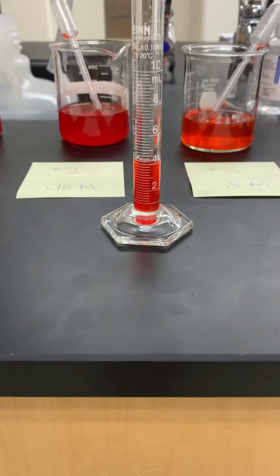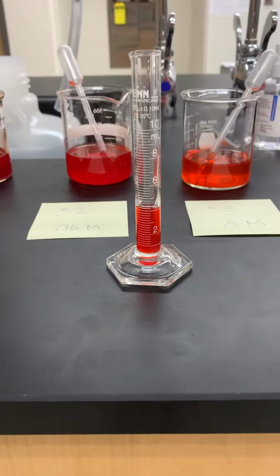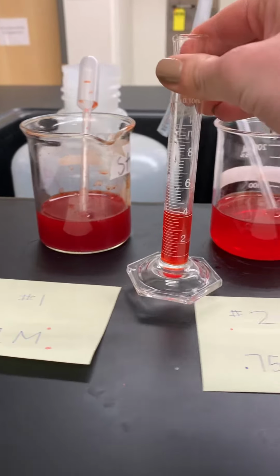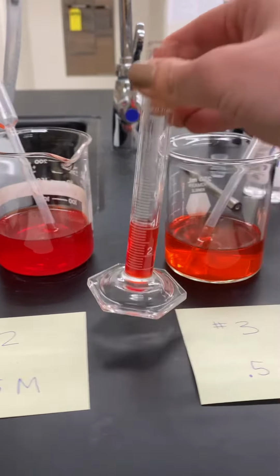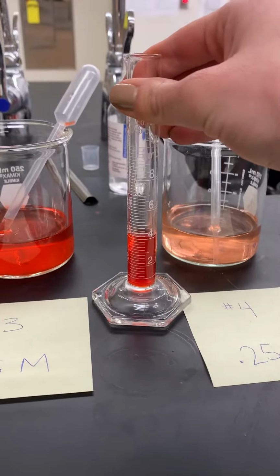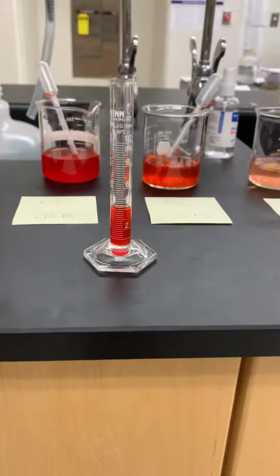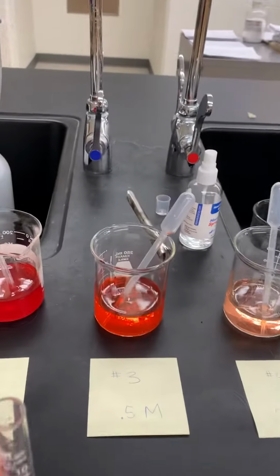And so we can do this pretty easy by looking at the color and deciding about what molarity it has. So I'll hold it next to each one of these so you can see the colors and see maybe what it's similar to or maybe what it's in between. And you can pick a number that might make sense. All right, so go back, pause the video if you need to, to find a number that might make sense for that one.